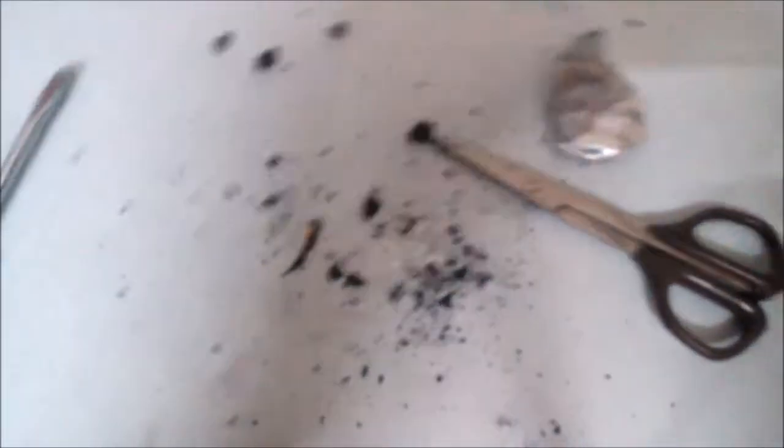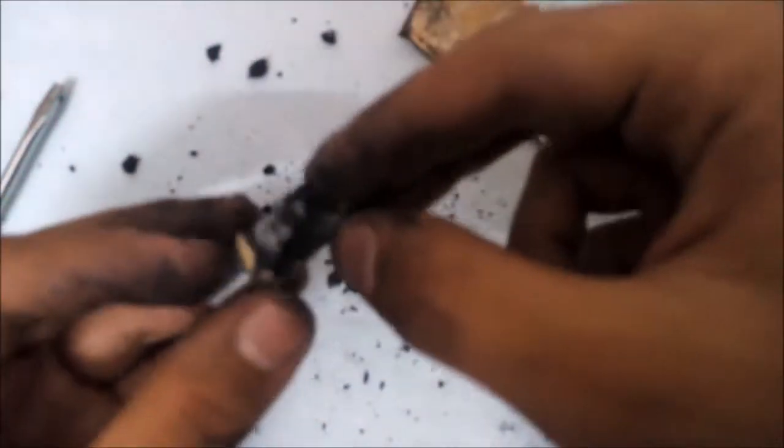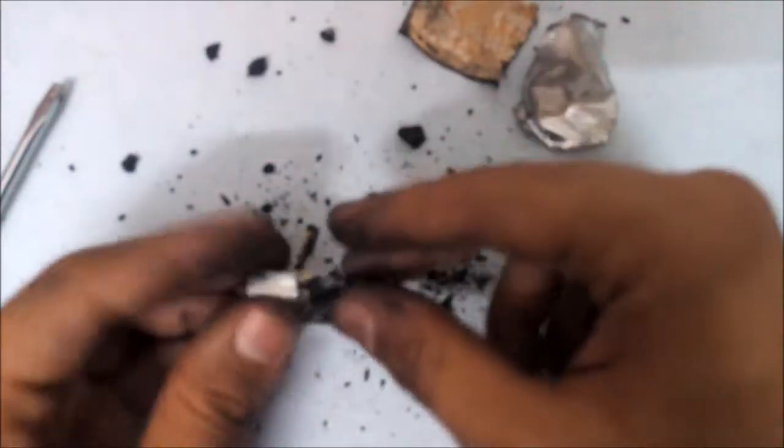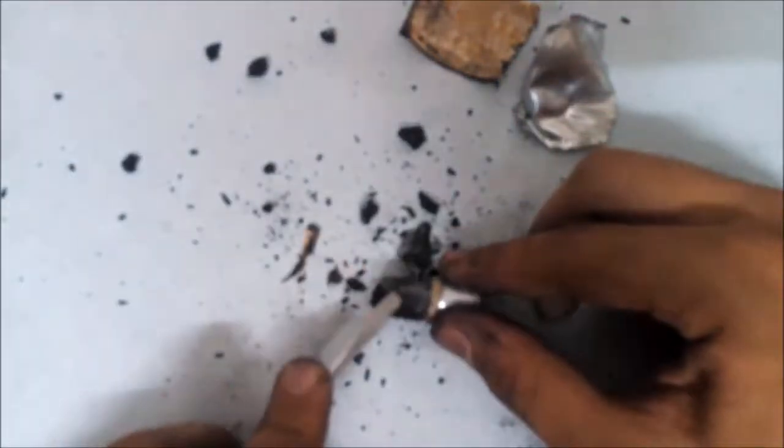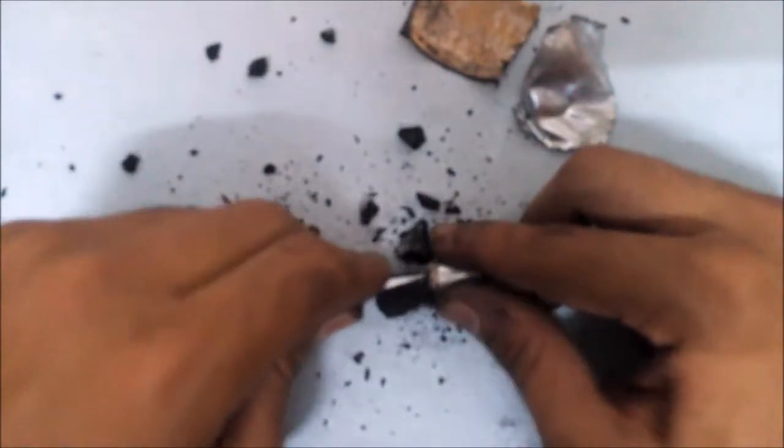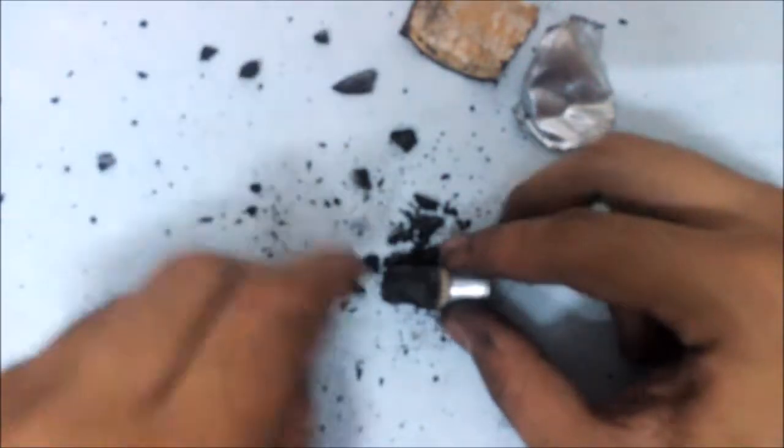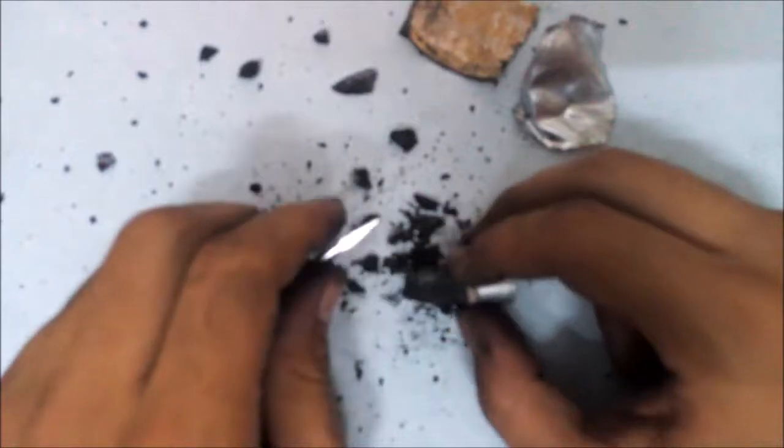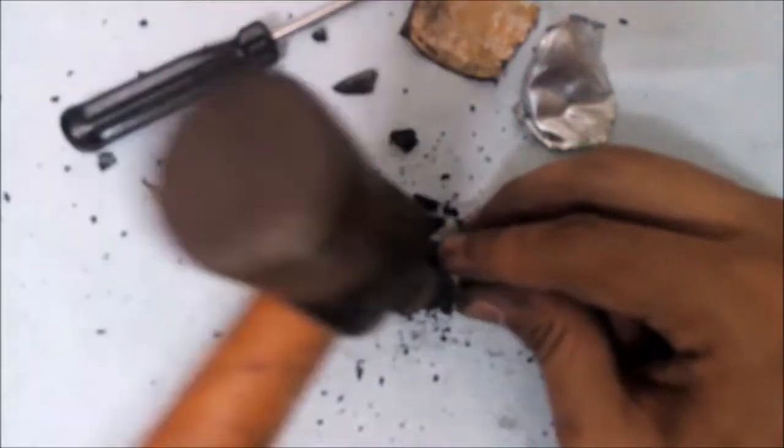Let's take it off. It will have some white patches of ammonium chloride, just ignore that. Inside you can see this powder substance which may be wet or dry. It's good if it's dry because wet means you're breaking a cell which has yet to be consumed a lot, so that would be a brand new cell and it's difficult to break open. A cell that is used up is comparatively easy to break. This is not too old nor too new, so I think we can hammer this out.